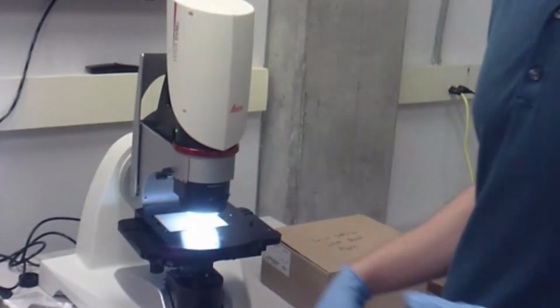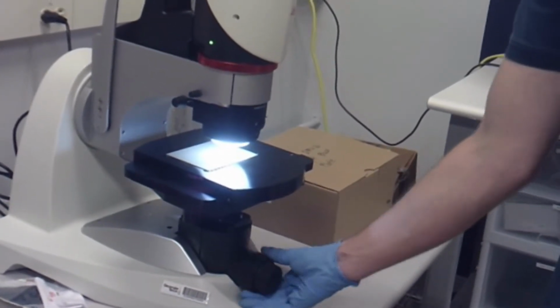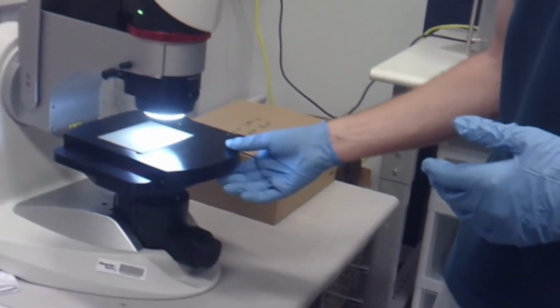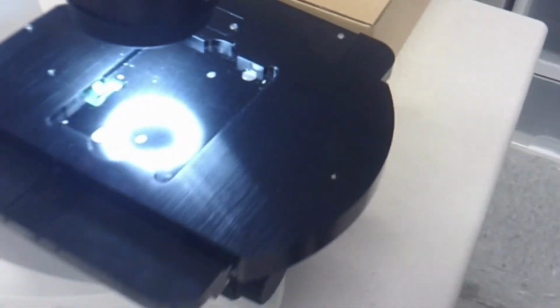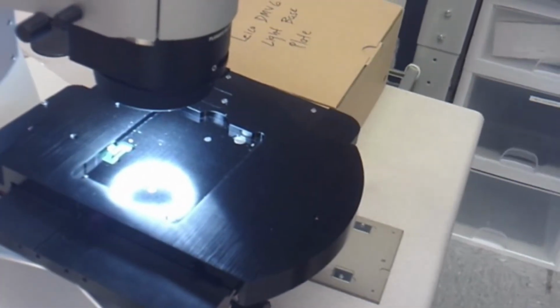The last thing I do want to cover here is changing out the base plate. So currently we have the basic no backlit base plate enabled, which is just a little piece of stone. It makes a good background because it's not super colorful or bright. But to change it out, it's really simple. You just take the base plate that you have in, you lift it up. As you can see, that's the bottom of the base plate right there. But there's no complicated circuitry or anything you have to change out to change the base plate. So just took that one out, and then we'll change it out with a light base plate.